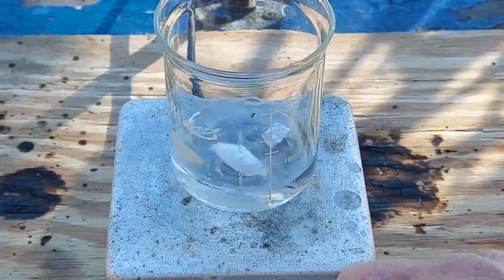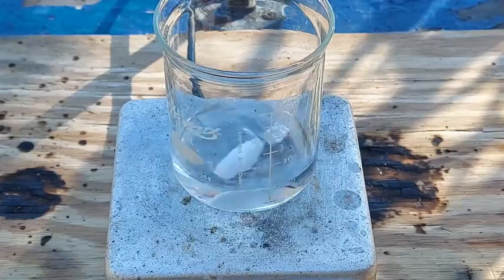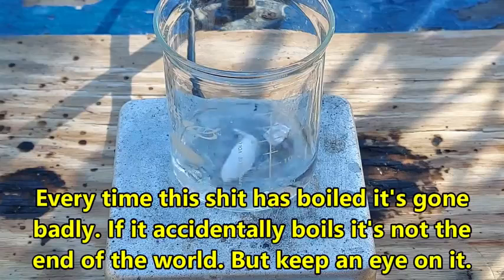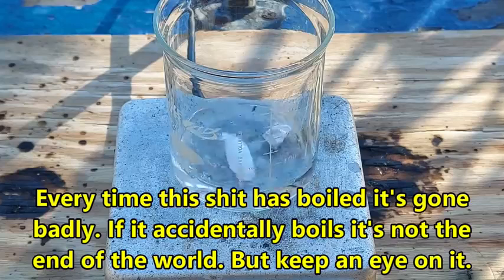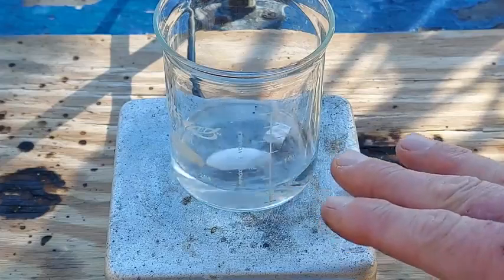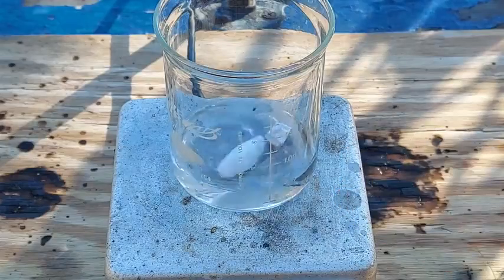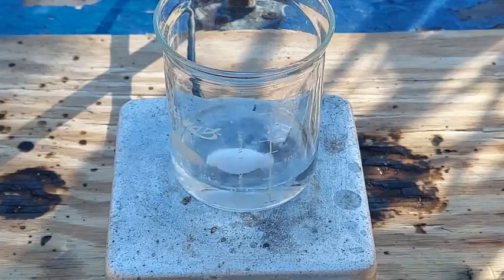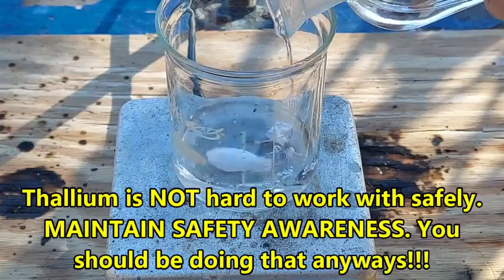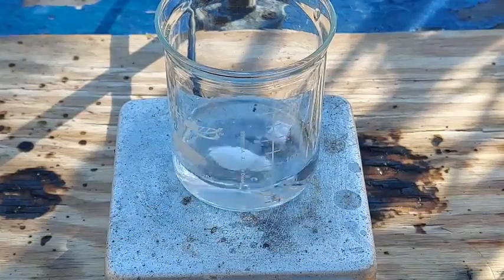And to heat this up, although not too close to boiling — if it gets too hot it's gonna go sideways. Keep it at about 70–80°C, it can be good and warm but should not approach boiling. You want to make sure the solution is not going to be producing a lot of aerosols or splashing droplets around, that would be bad. We don't want to go overboard on the sulfuric acid either; if I need to dilute it I'll just use water.